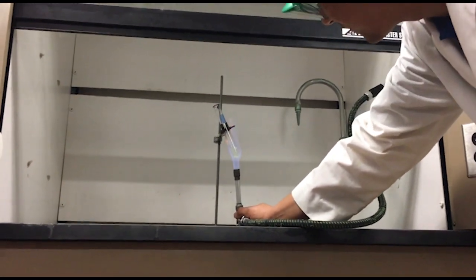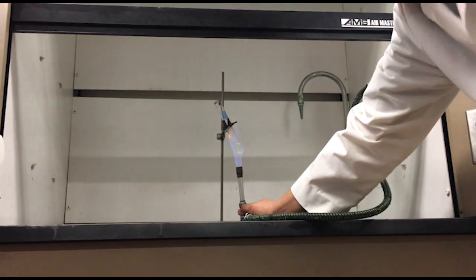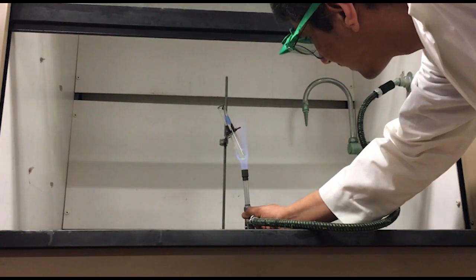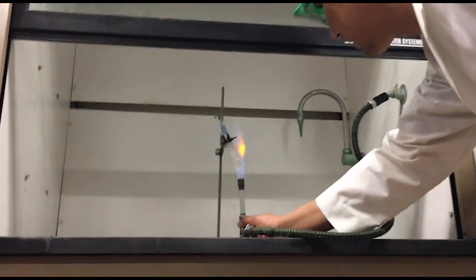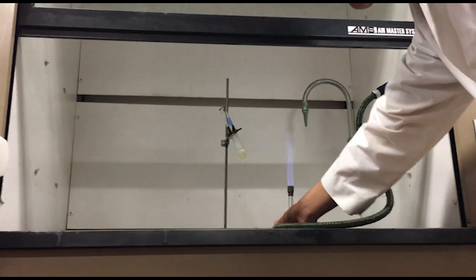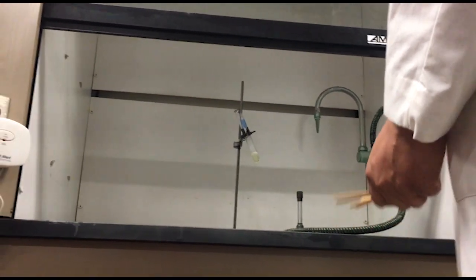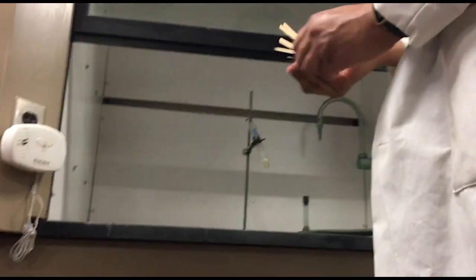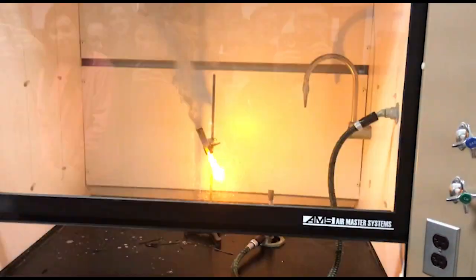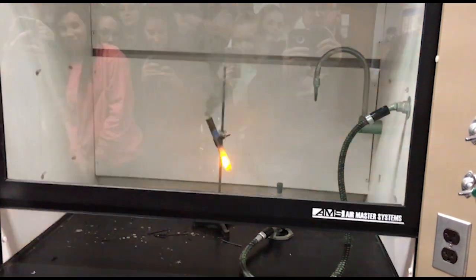Okay, just a little bit at the bottom. I want to get as much oxygen in there as possible so we have a really good reaction. Just a little bit left. Okay, I think that's pretty good. So now I'm going to shut the gas off here and I'm going to add some fuel and let's see what happens. I recommend that you not sit on the floor. Now let me add two splints and see what happens.